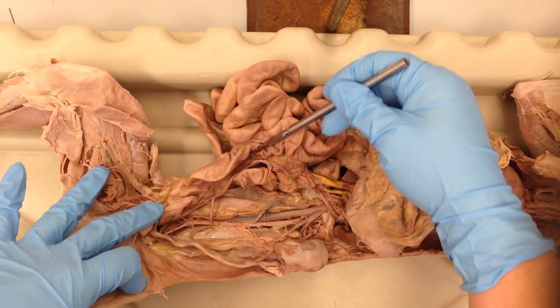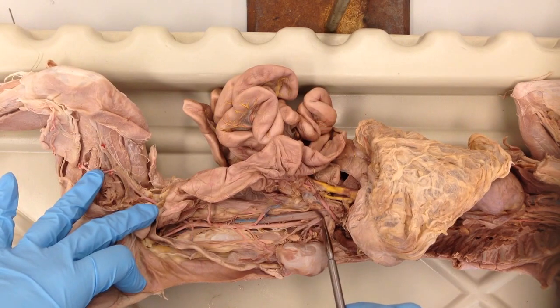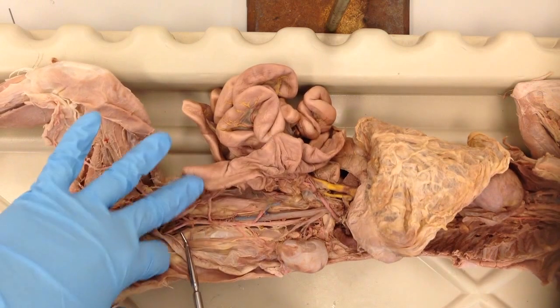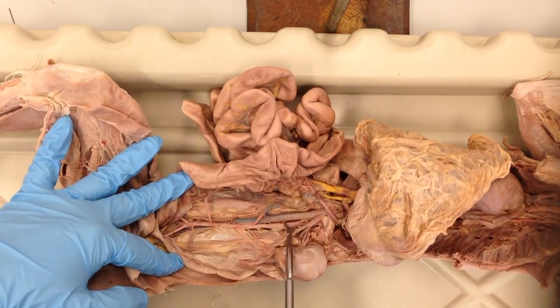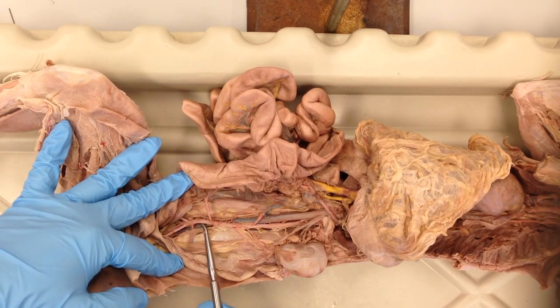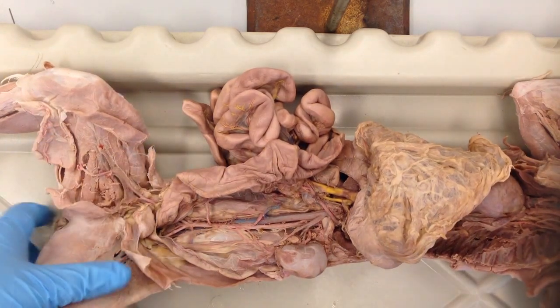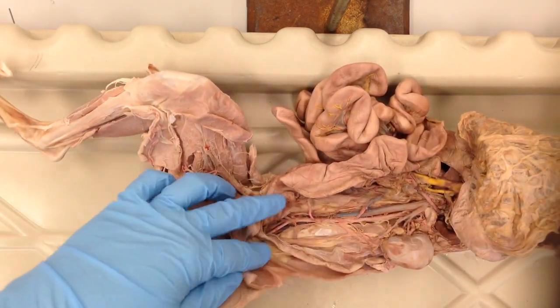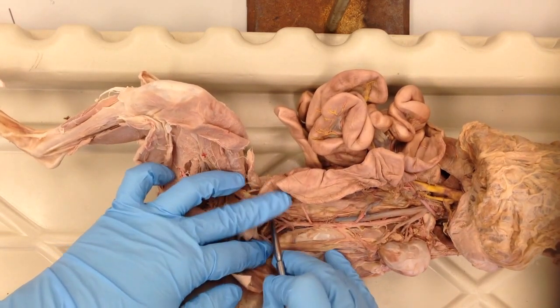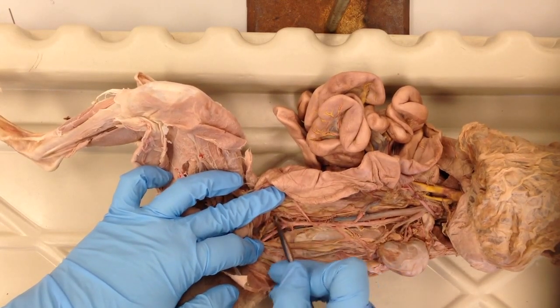Of course this is the inferior vena cava, the vein colored blue, and the abdominal aorta. As we move down, we'll note that the aorta tends to be on top of, or anterior to, the vena cava. You can see that here. I'm going to move the cat so you can see further up in the center of the video. Notice here you have some branches at the end point of that abdominal aorta. Note that the abdominal aorta starts to branch.